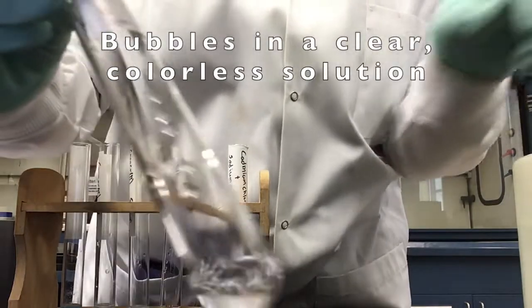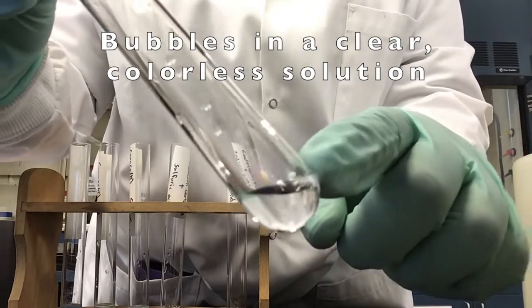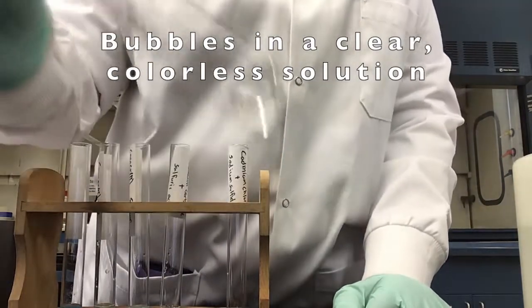Our solution is still clear and colorless. Upon mixing our sodium carbonate and our hydrochloric acid together, we still see a creation of bubbles.